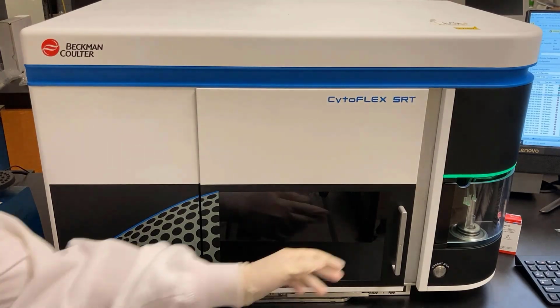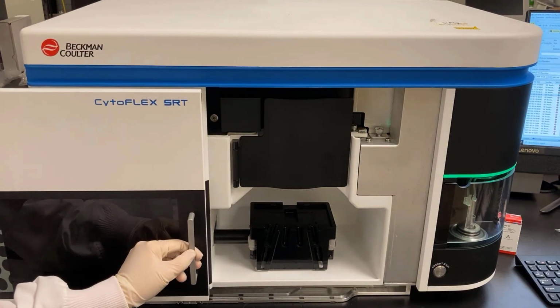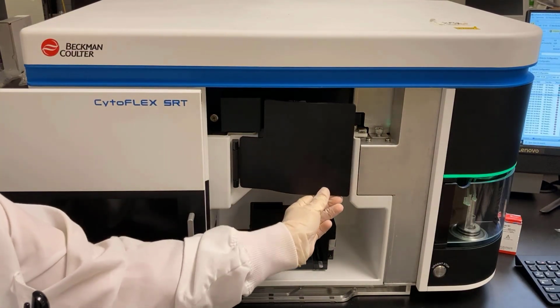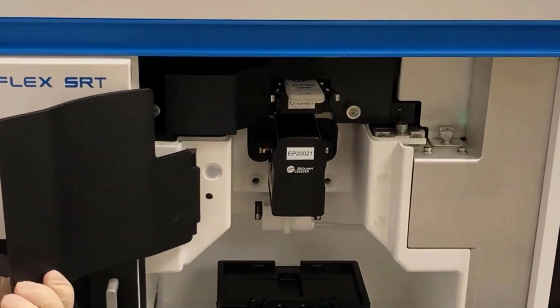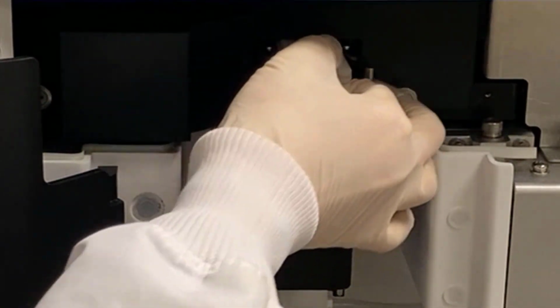Open the sort chamber sliding door. Open the sort protection door to access the nozzle module. Remove the nozzle module by pushing the metal release clamps inward.